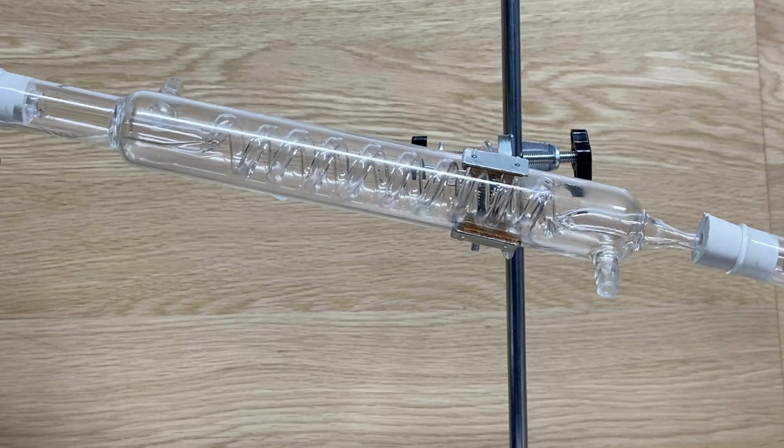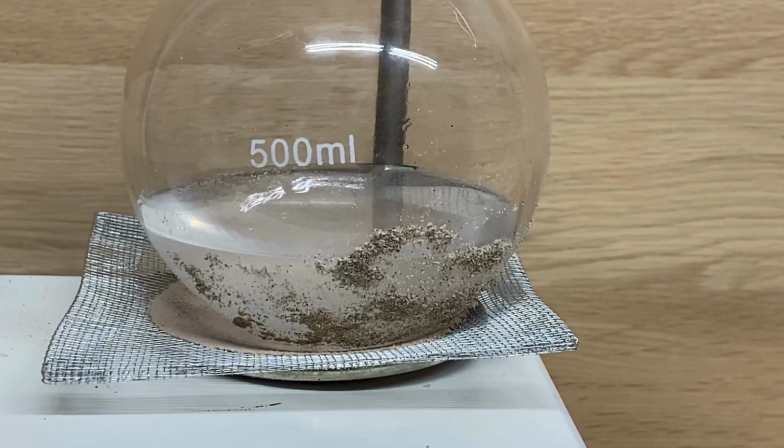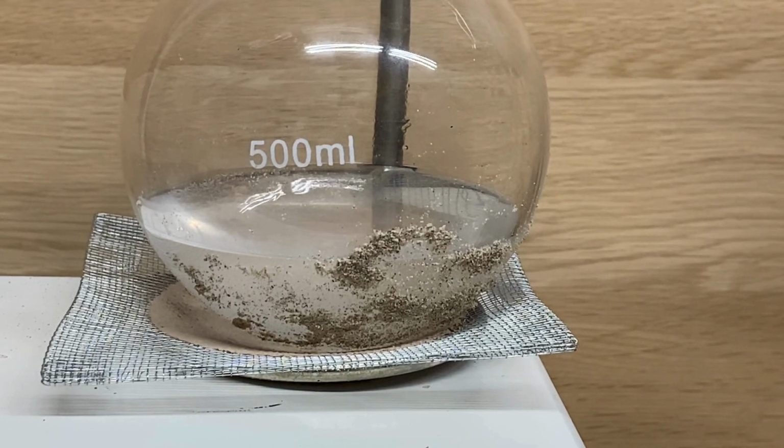So, what happens with the vapor then? Well, the vapor goes through this beautiful swirling tube, which we also call a condenser. Now, you can connect the condenser to running water to make it cooler in there, but I've decided to do it slightly different in this case. After the vapor cools down, it will liquefy again inside of that tube, and the alcohol will start to drip into the Erlenmeyer flask that I surrounded with ice to cool it off there. In theory, the alcohol we will capture will have a higher percentage than we had when we started boiling it. As you can see, I tried to use a bowl of sand first, but since the sand worked quite isolating, it took way longer to heat it than I wanted, so I basically took it away.